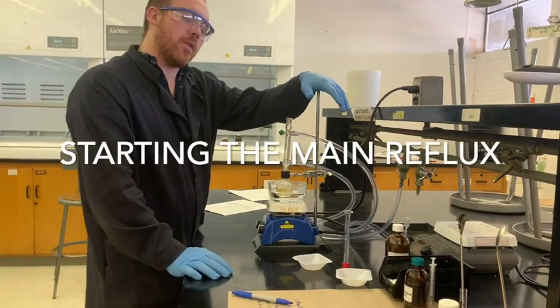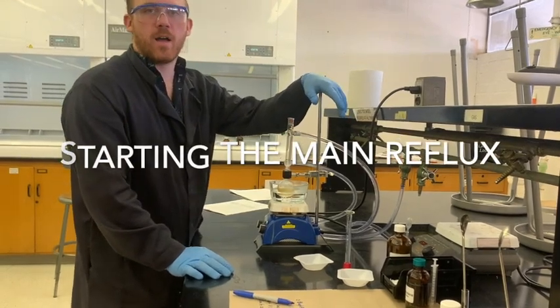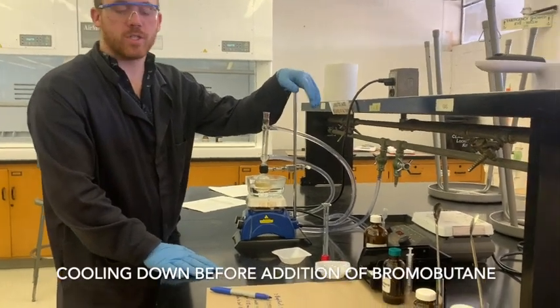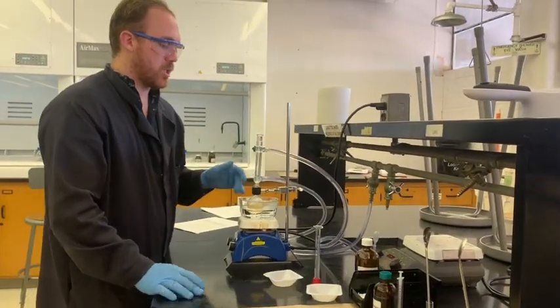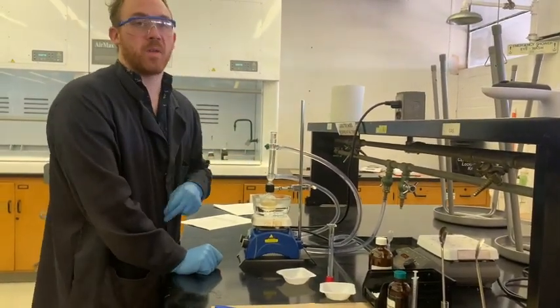So it's been going for about 30 plus minutes. I've been letting it go a little bit longer just because we're working on something else. It doesn't really matter too much. Mostly we're trying to just deprotonate the naphthol.